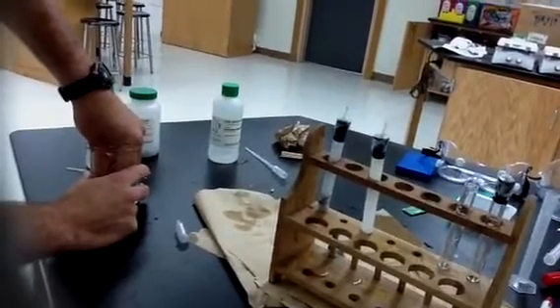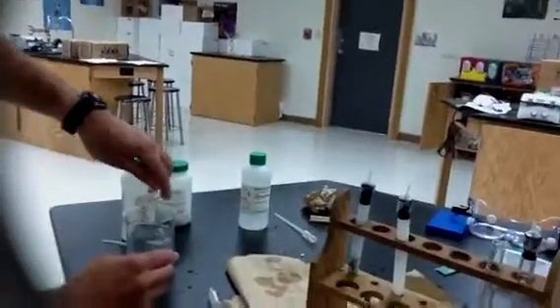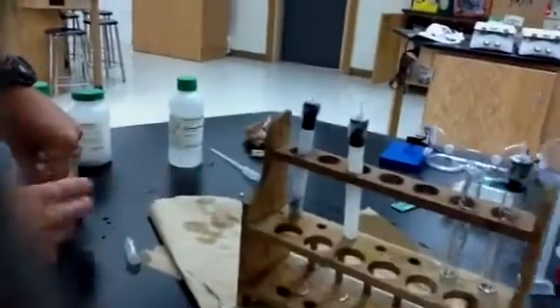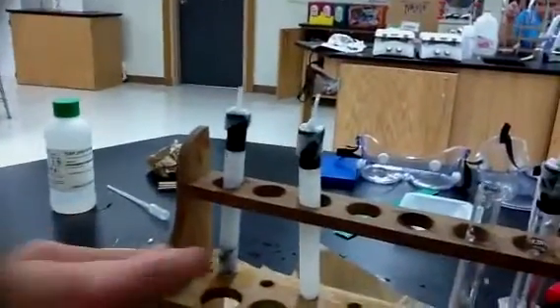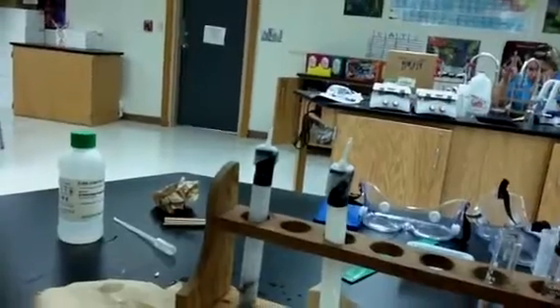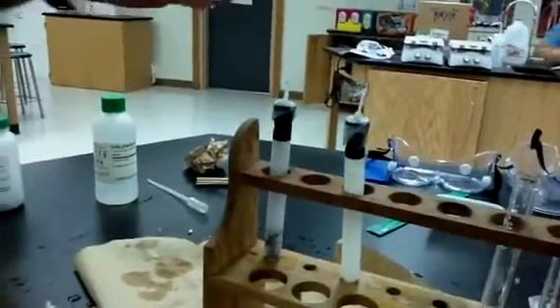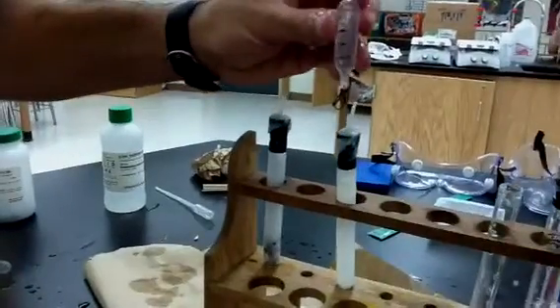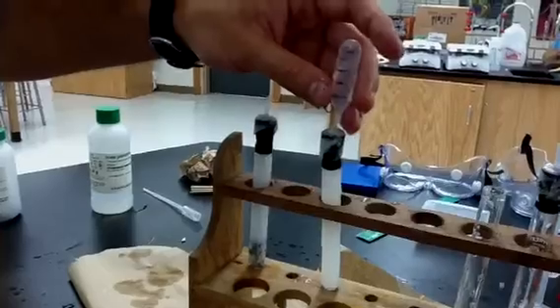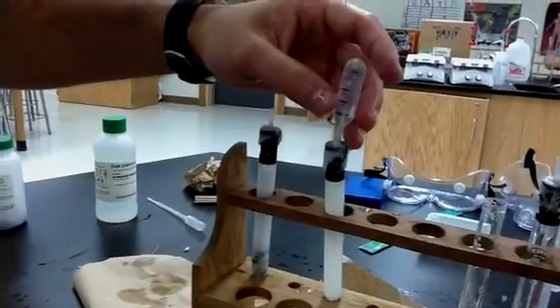I'm going to go ahead and refill this thing right here. Look at our gas generators, they're going crazy. Look at that hydrogen gas generator. Look at that chemical reaction here. It's hot. It is a hot test tube right now. Okay, I've got my test tube filled once again. I'm going to try that again. Let's see if we can get a little bit better reaction out of there. You got to make sure that, okay, so we're going to fill it with oxygen gas. We have oxygen gas being generated.